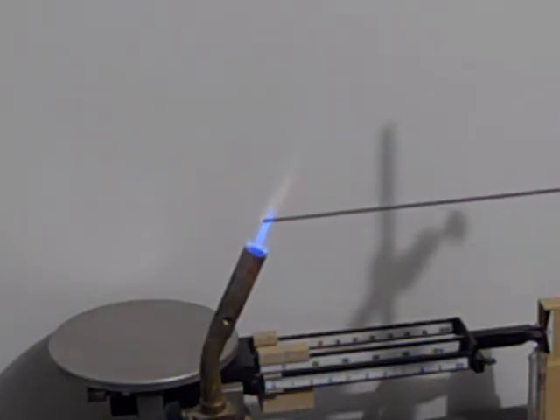Ah, that's the barium. I got them mixed up. You see the yellow-green? I've got it mislabeled. I'm rushing this out because a lot of students are not getting positive results here.